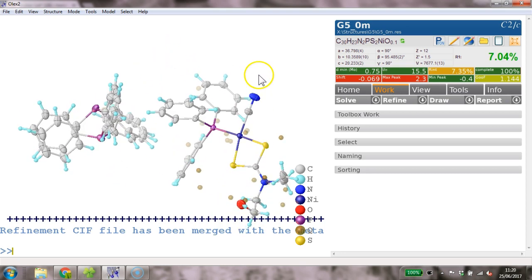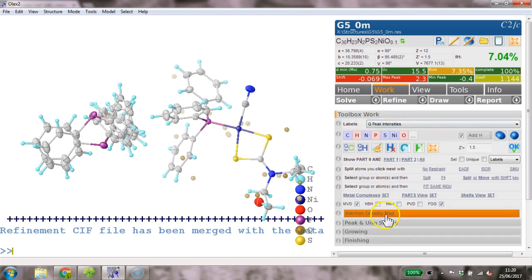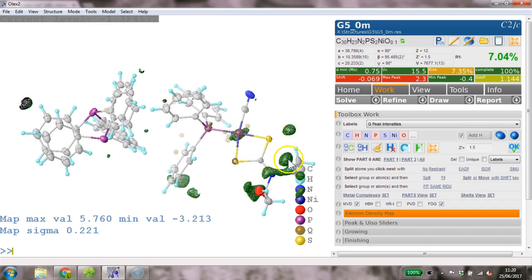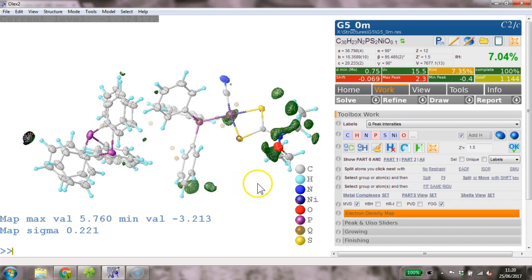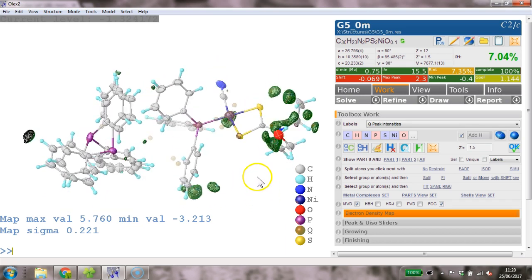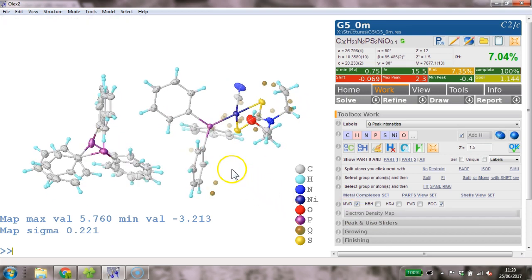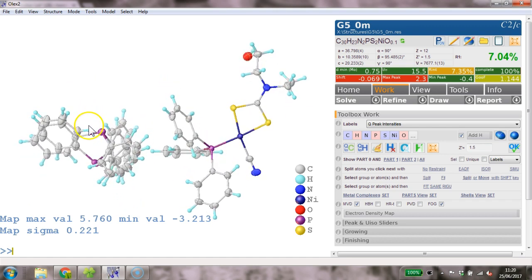Okay, this looks quite healthy now though, so I think this is this way around. CN, we can look at the map again and verify that this is the case. So yeah, there is some extra spurious peaks that I cannot explain. So there is something here, there is something here. So a few things are going on that I'm not sure what it is. Anyway, the purpose of this little demo was to show how to model this triphenylphosphine, and I think that was quite easily done.